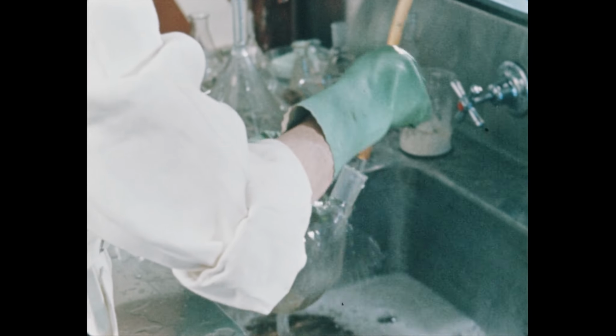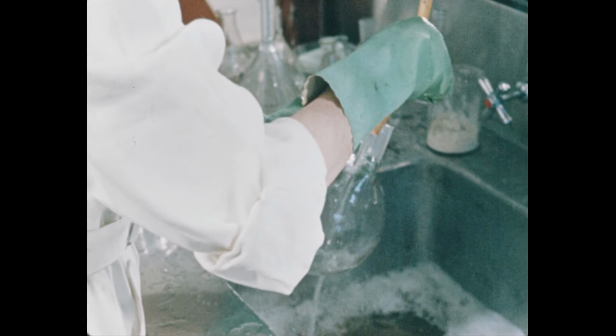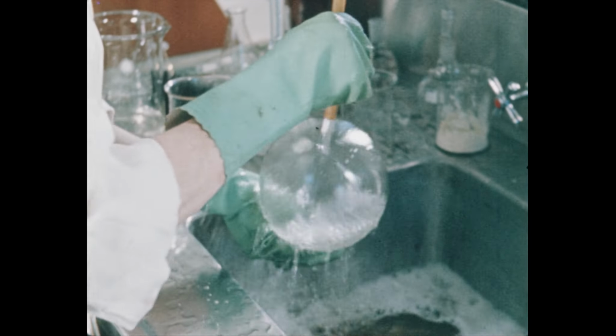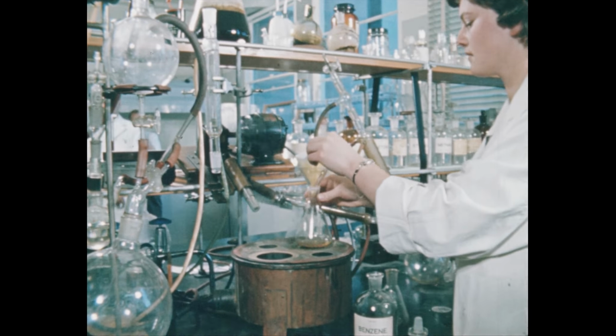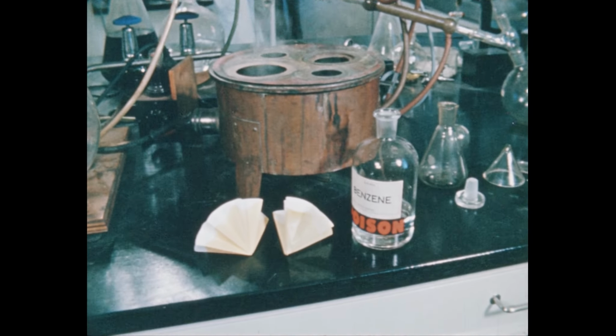Good safety practices can be seen, of course. A sink in a fume cupboard is the place to clean up glassware after use, wearing gloves. But have you ever left benzene-soaked filter papers lying about? Or a stopper out of a bottle?